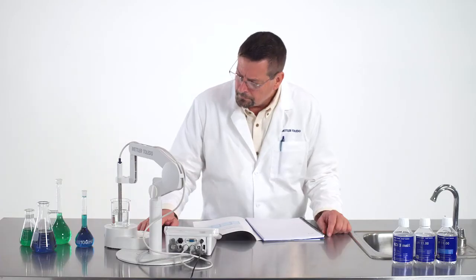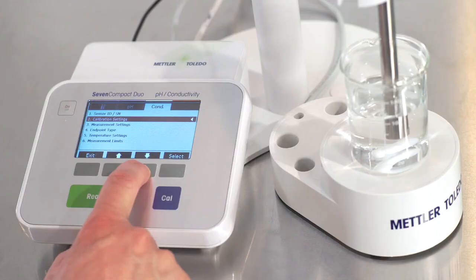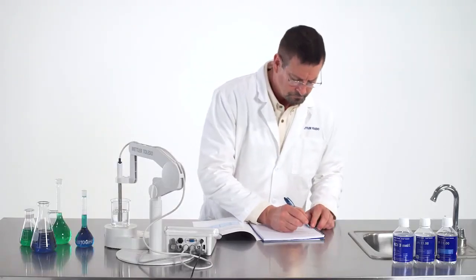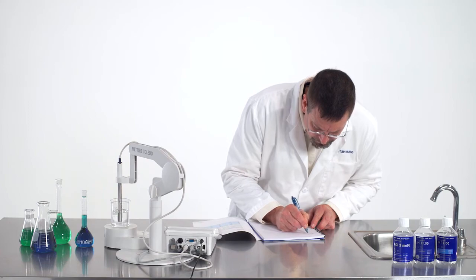In the event of a failed test, the procedure requires additional steps and the use of a pH meter, making it even more susceptible to error. Finally, once the measurement is complete, the result is recorded manually, offering yet another opportunity for error.